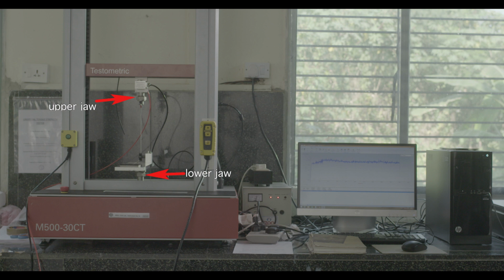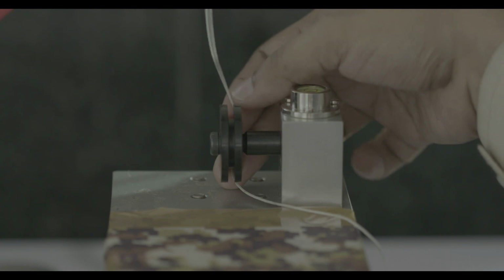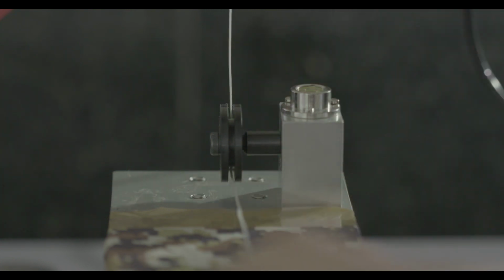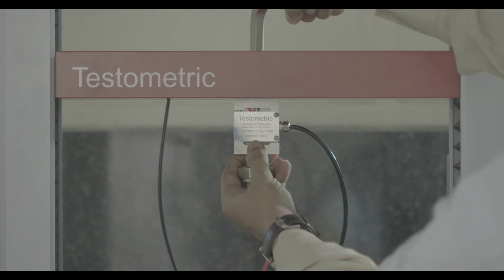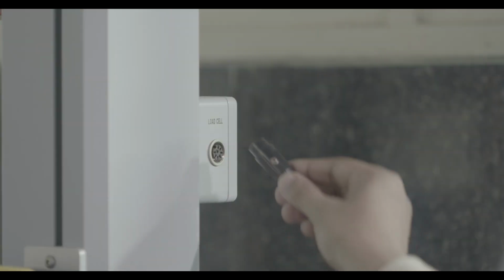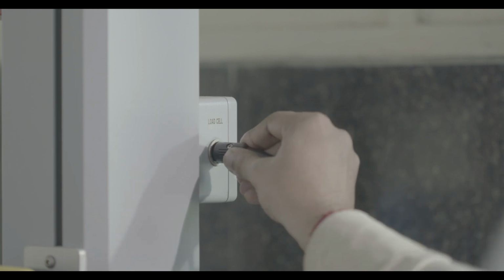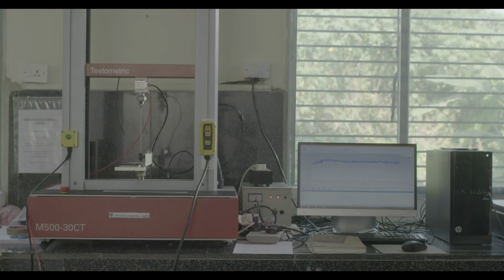This can be moved over the slide by means of a dragging action by a thread attached to the upper movable jaw of the instrument. A standard validated string thread shall be used which is attached to the upper movable jaw. First attach the load cell of required capacity in the instrument and connect the load cell connector pin to the port of the instrument. Next attach the slide, the lower friction plate, to the lower fixed jaw of the instrument.